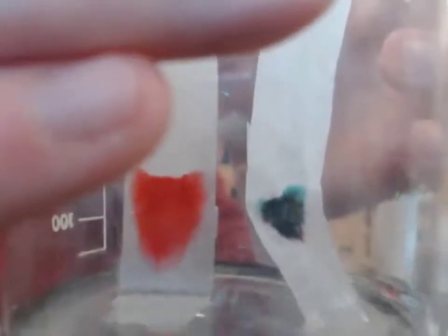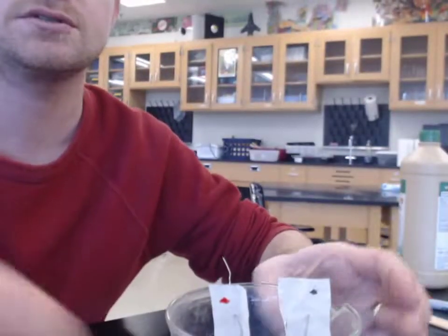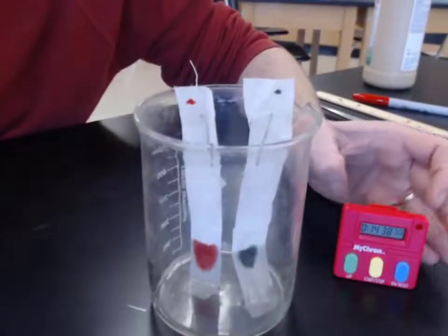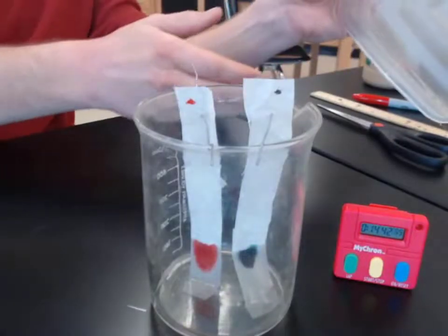Doesn't seem like there's much happening with our orange one or our red ink, though parts of it do look more pinkish now. That might be a good observation, especially for the black ink. It seems to be composed of something more. Just the black ink. Let's see if we can prop this up, maybe make it easier to see.